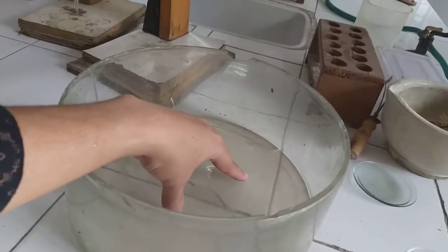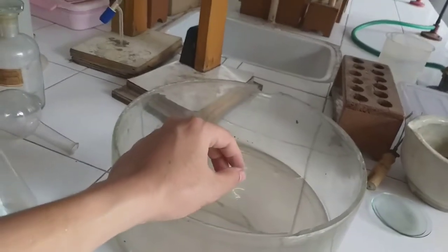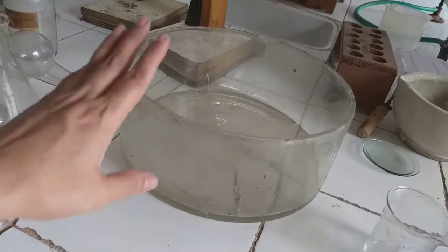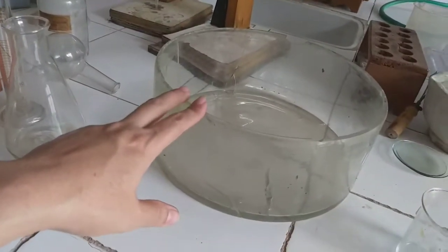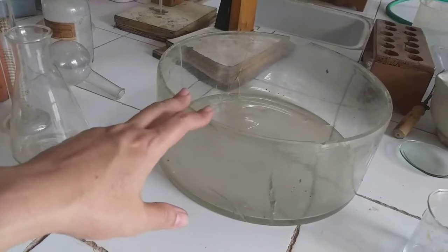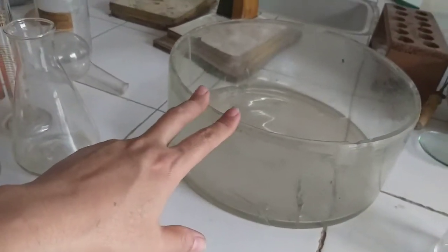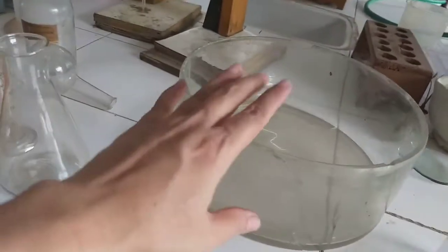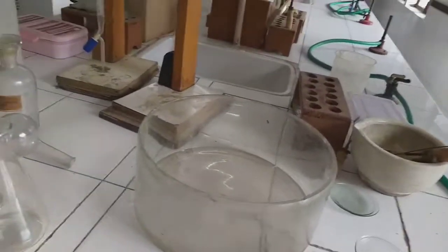We keep a beehive shelf over here, and on top of it we keep a gas jar. You have seen this apparatus in those diagrams where gases are being produced and collected over water, for example carbon dioxide, oxygen, hydrogen, or gases may be collected over mercury also. So this is called a trough.